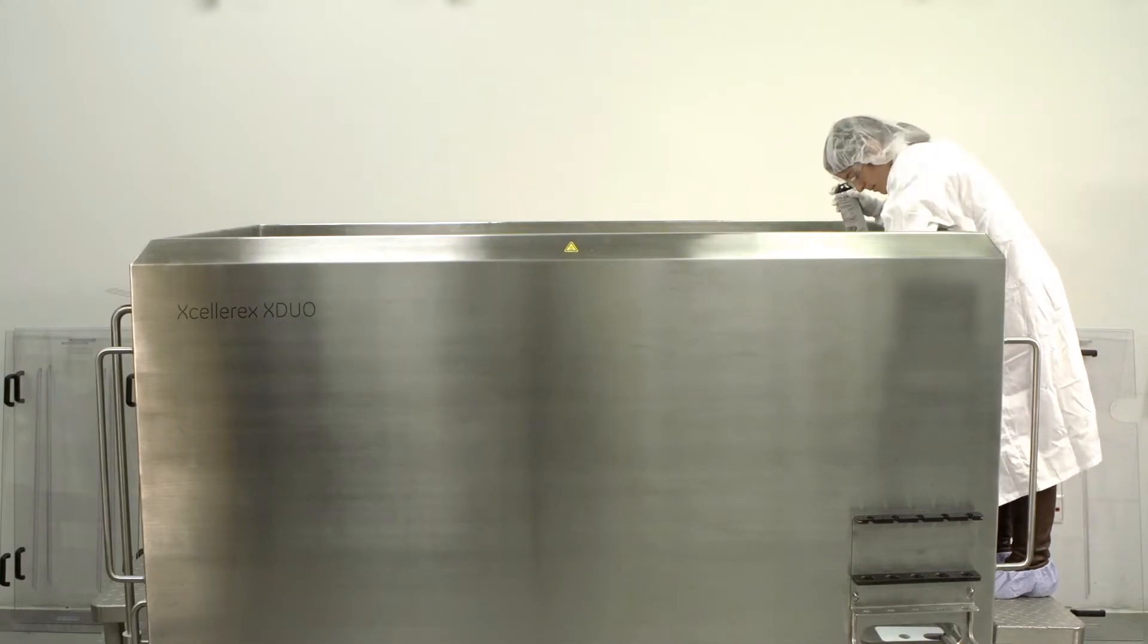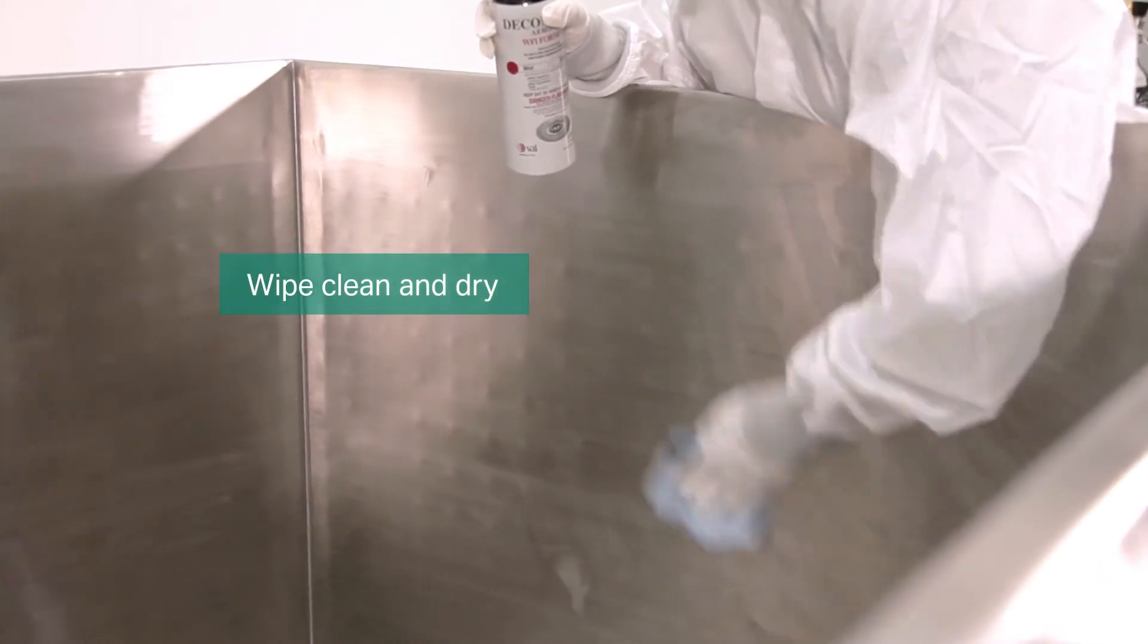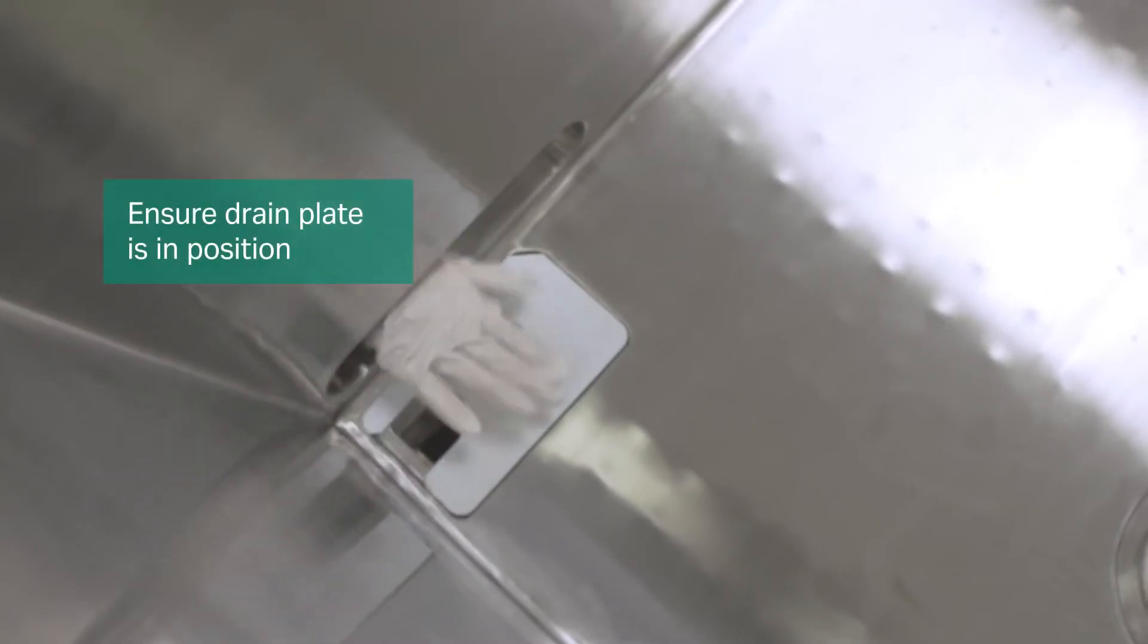Wipe the vessel walls with ethanol or other cleaning agent prior to use. Make sure the drain plate is in place.